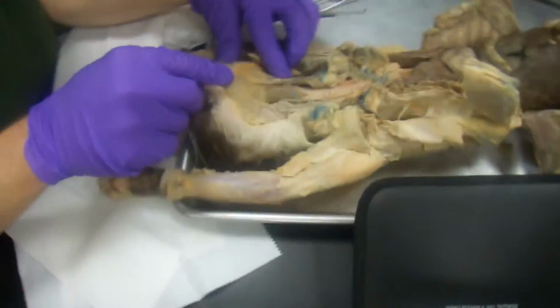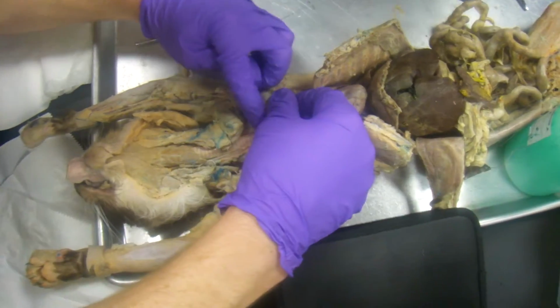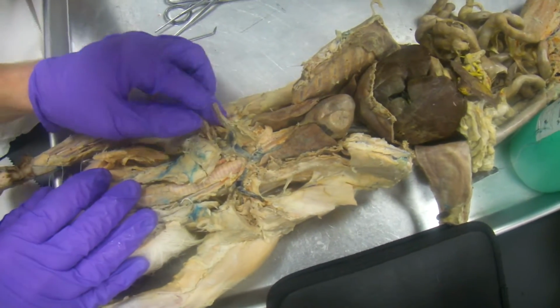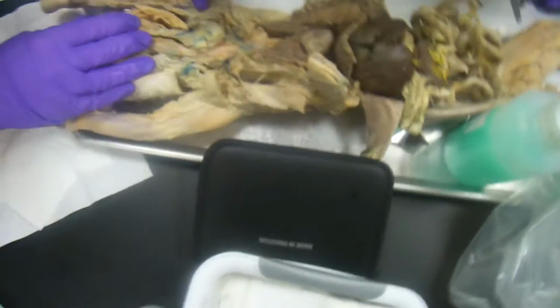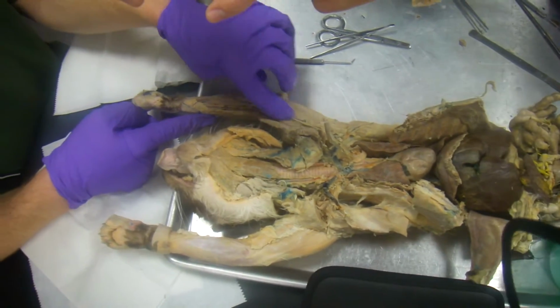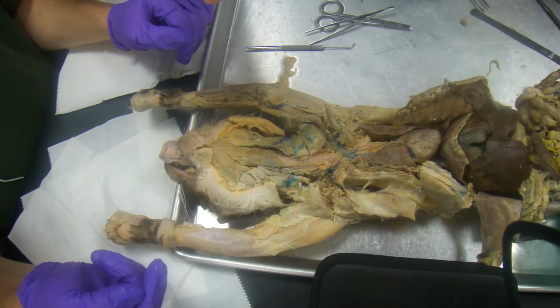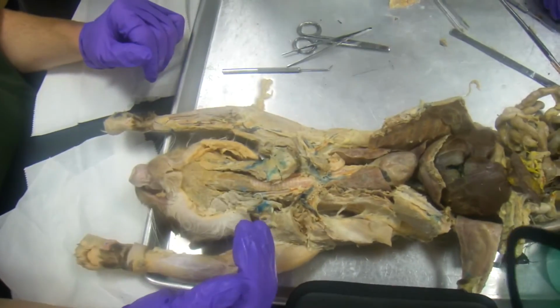Jugular goes up here, and then the internal jugular goes back here. And then if you follow this right here, this branch, it turns into the subclavian, and the subclavian turns into the axillary, and then the axillary turns into the brachial. The brachial turns into the radial, which is going to be closest to the head, and then the brachial is also going to turn into the ulnar, which is the farthest from the head, over here. And that's all you need to know for this part up for the veins.